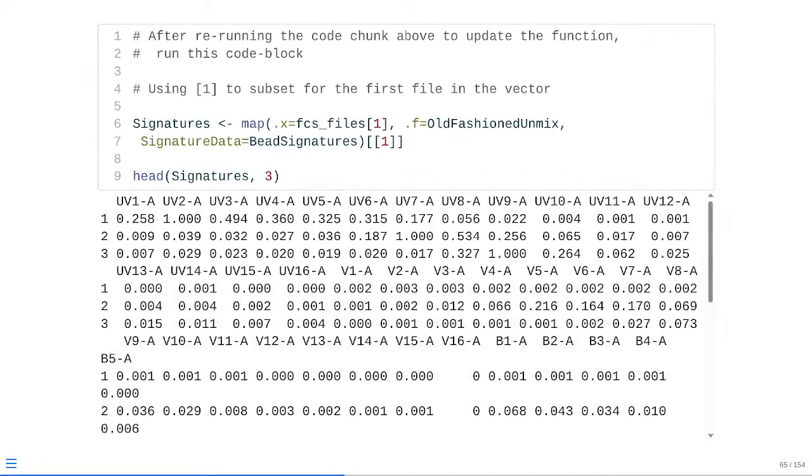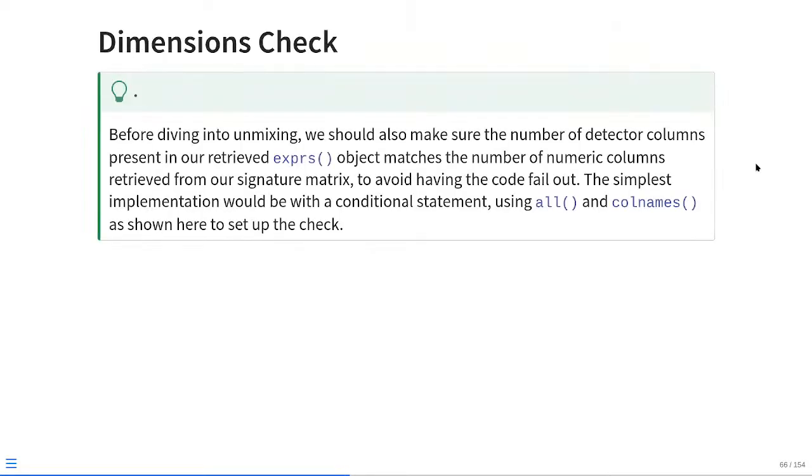So, refresh our function, rerun our line, and as you can see, nothing has changed in our particular case because all these values had already been normalized. And before we dive into unmixing, we should make sure that the detector columns present within our exprs object end up matching the total numeric columns present within our signature matrix, so that we avoid having our code fail out without any understandable explanation about why.